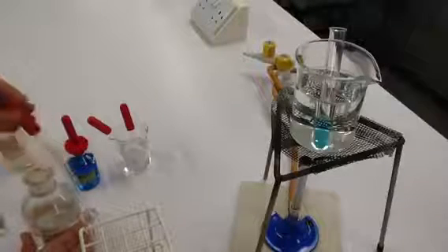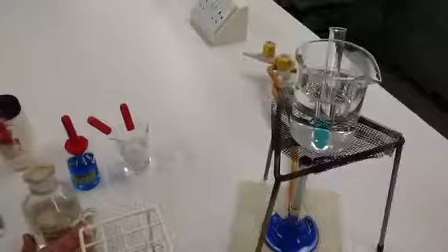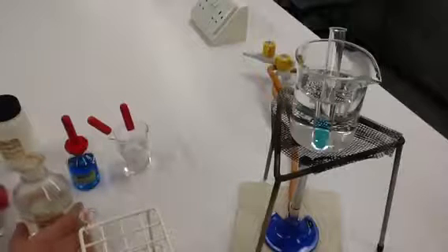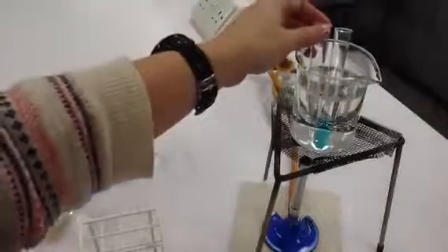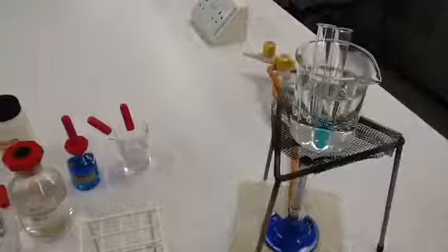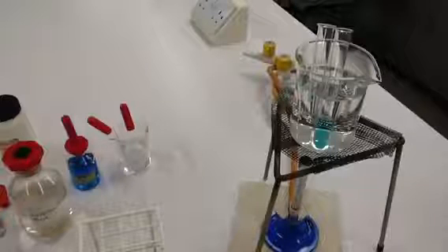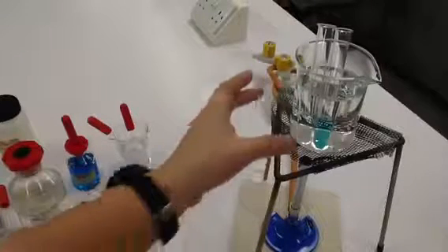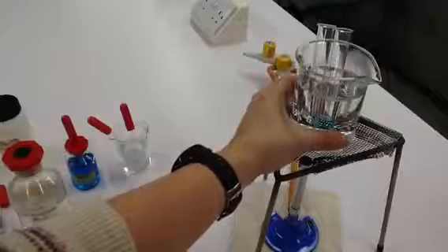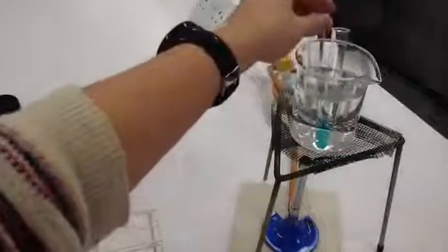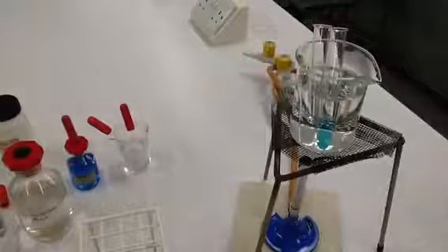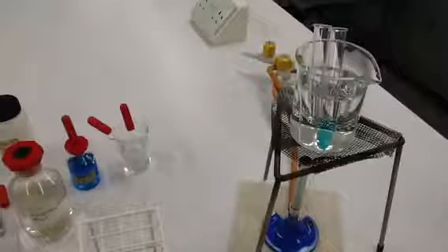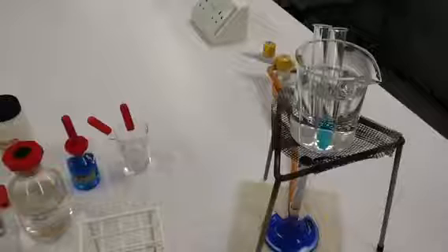We're going to heat the sample up again after adding our hydrochloric acid. So hydrochloric acid added to our solution, and we're placing it back into the water bath. We place it back into the hot water bath for around about two to three minutes. It's really important that this water is as hot as it can be so the acid starts to work. We'll talk about what's happened and what that acid is actually doing to the sample in a sec.